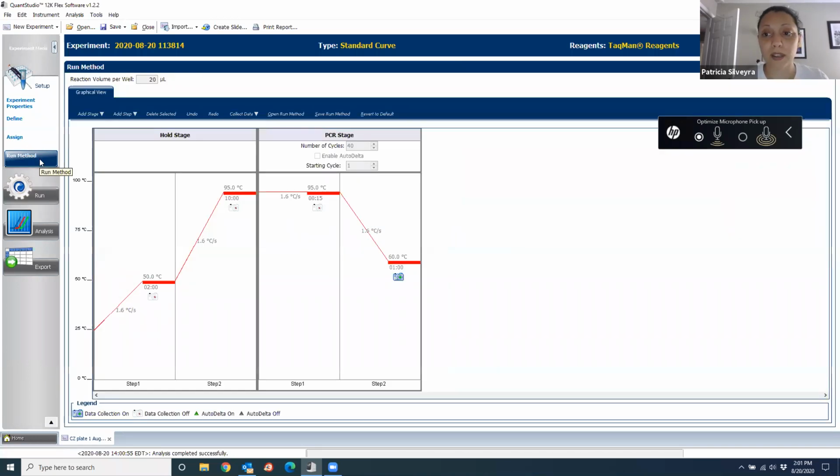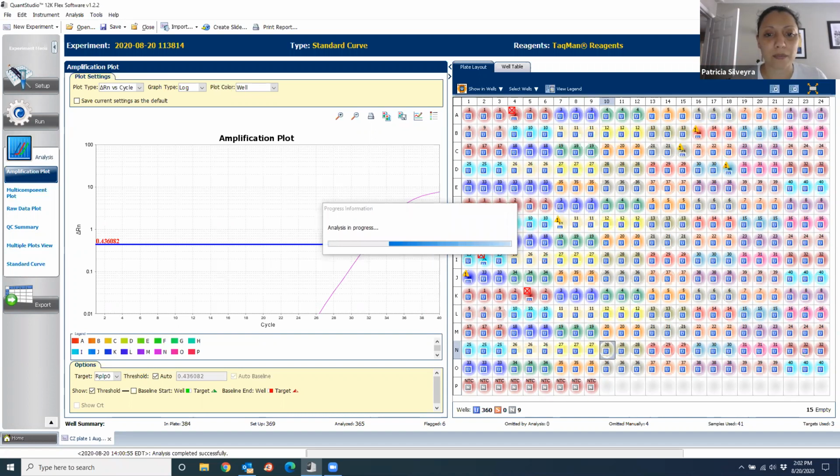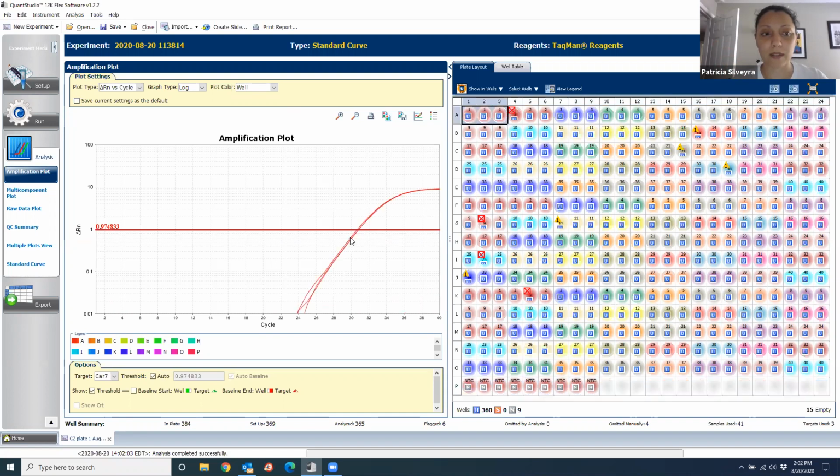So as I told you, when I explain you how to do this, you can always add and remove things, and the machine took all the information for all the wells. So now we analyze one more time to make sure that no template controls show up. And you see here these three numbers. Those are the thresholds. So that is the amount of fluorescence that is gonna meet the curve, right? So for example, in this case, this is the threshold, 0.97, and at the cycle where this sample met the threshold is at the 31 cycle, approximately, see, something between 30 and 32.